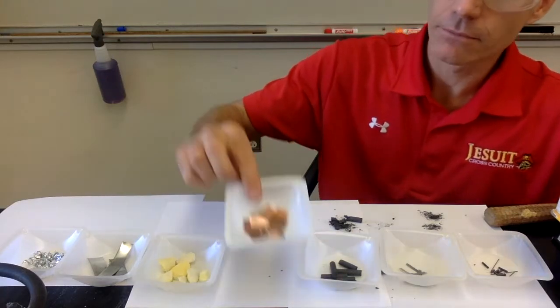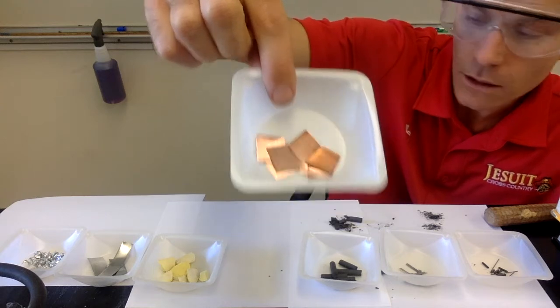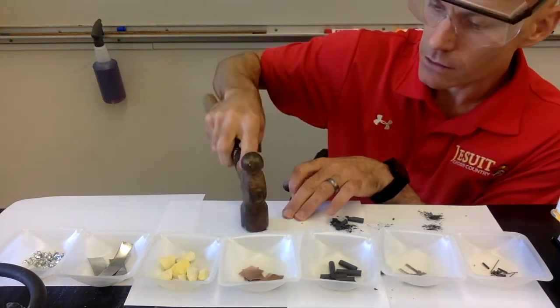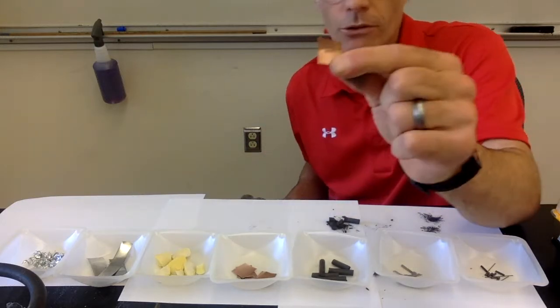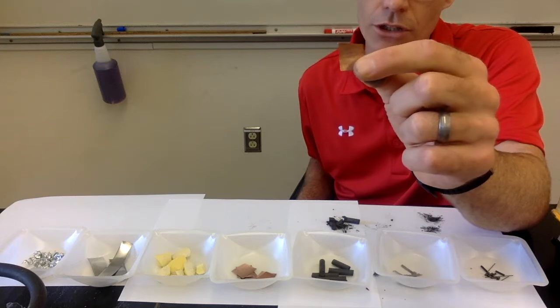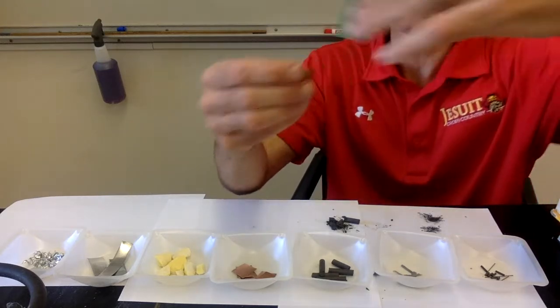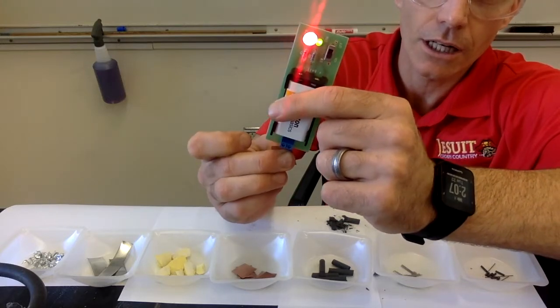Here is D. So this is substance D. You can check out its physical appearance and record what it looks like. I will do the test with the hammer. So here's our hammer, and we'll hit this substance with the hammer. You can see maybe a few small dents in it, but it didn't break. It didn't change too much. Maybe just got slightly flatter and a couple little dents in it, but it didn't crumble. It didn't get crushed. I'll check the conductivity of this one. And so that does conduct electricity. The lights are turning on.